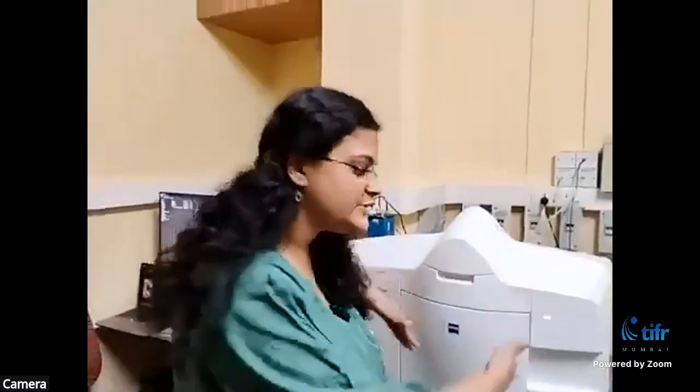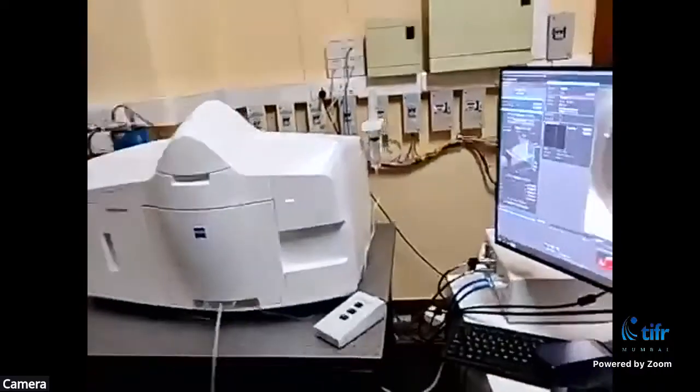Yeah. So the refractive index of all the lenses, the illumination optics, the detection optics, the chamber, everything is set to the refractive index of water, 1.33, so that we can fill the chamber with water and image the embryo in a live condition where it can grow properly. So that's how we work with the system here.